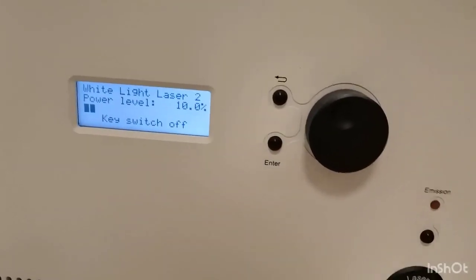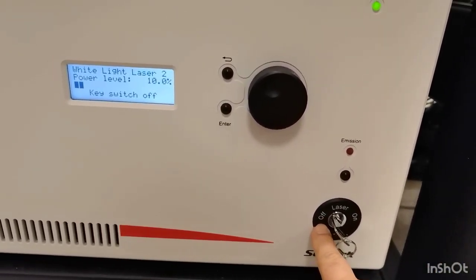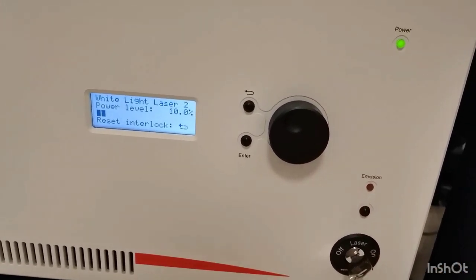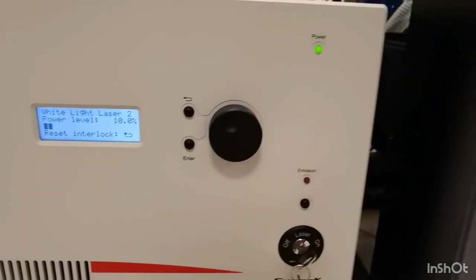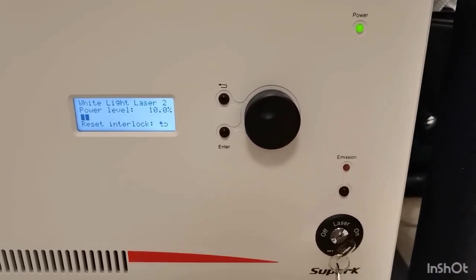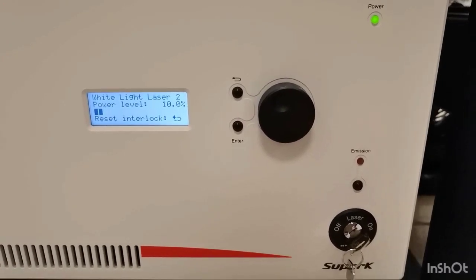The white light laser box is in here, and the box is vibration sensitive, so if you hit it harshly or if you put something on top of it, it affects the lasers, and the lasers then have to be calibrated or realigned. So do not put anything on this box, and if you do so, please inform the engineers.